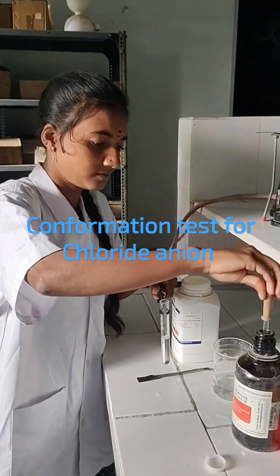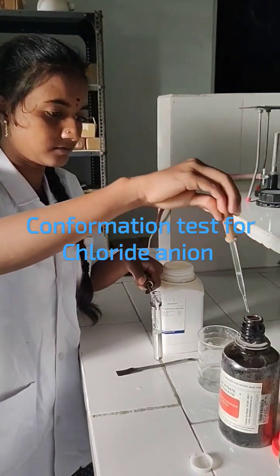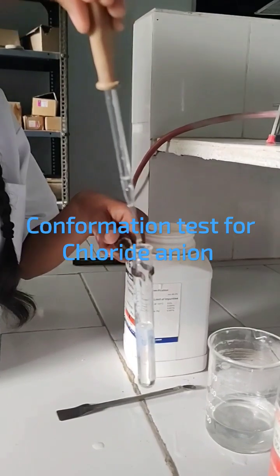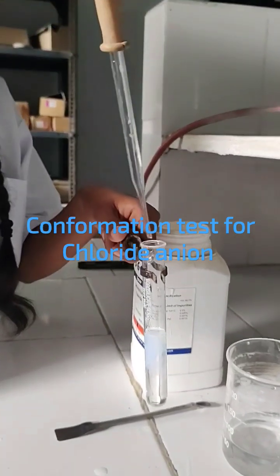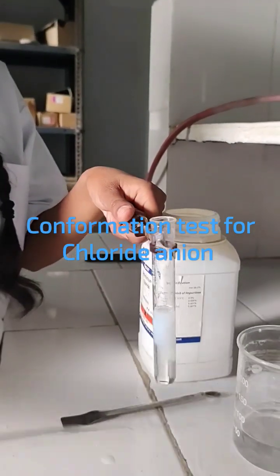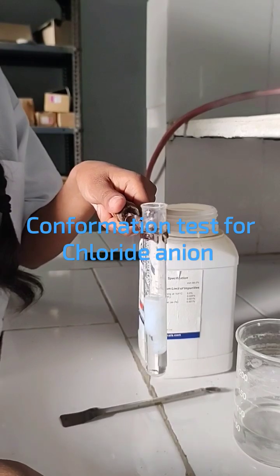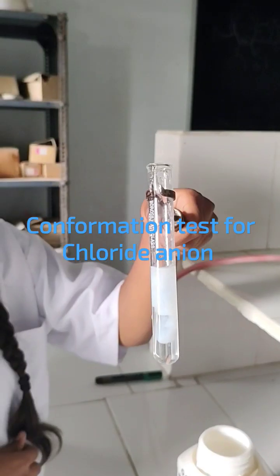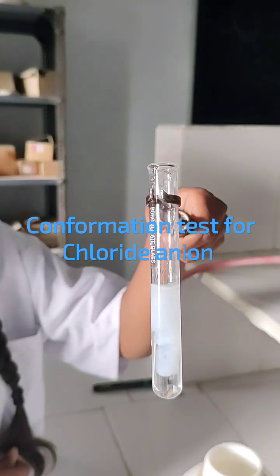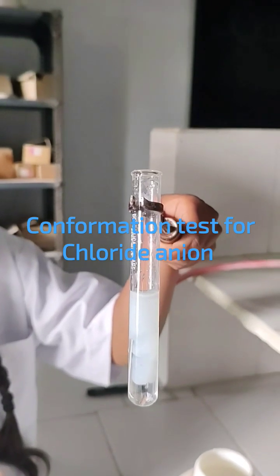To the prepared chloride solution, we have to add silver nitrate solution. With this, we are creating a precipitate — a curdy precipitate is formed. Now we are going to dissolve this curdy precipitate in ammonia solution.